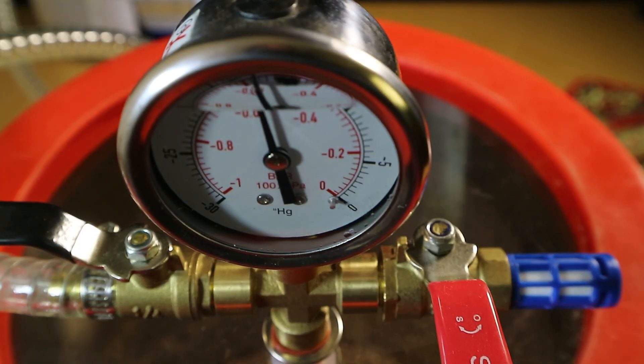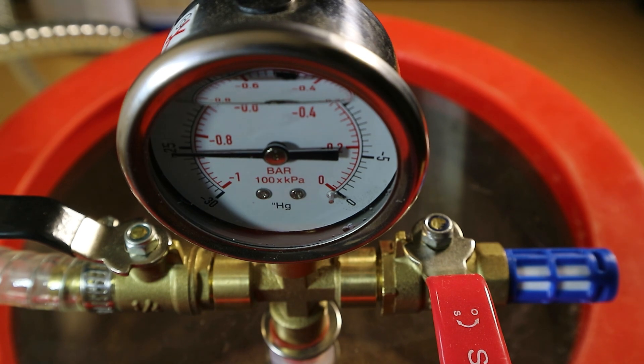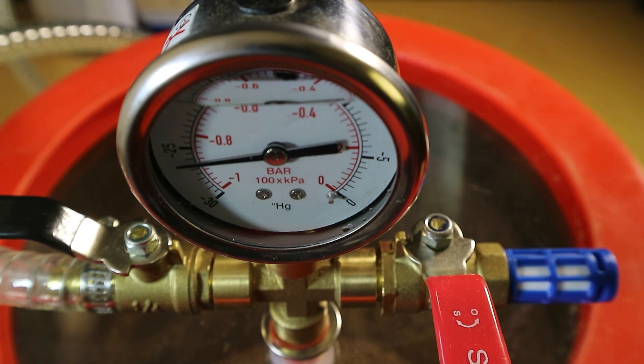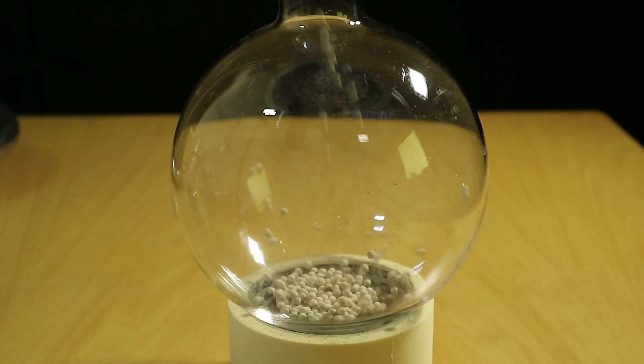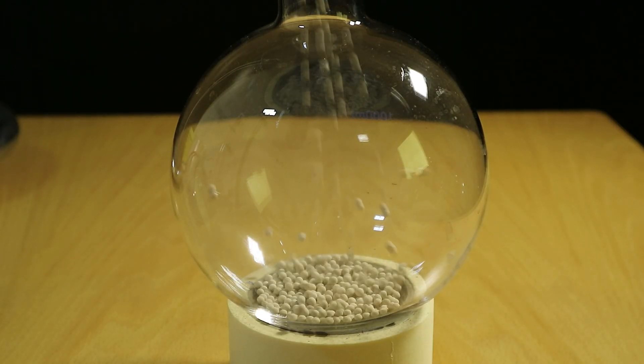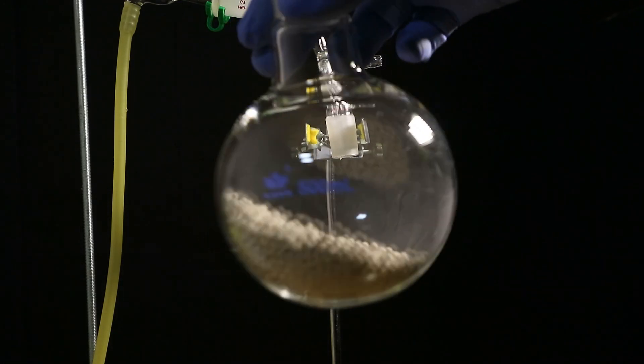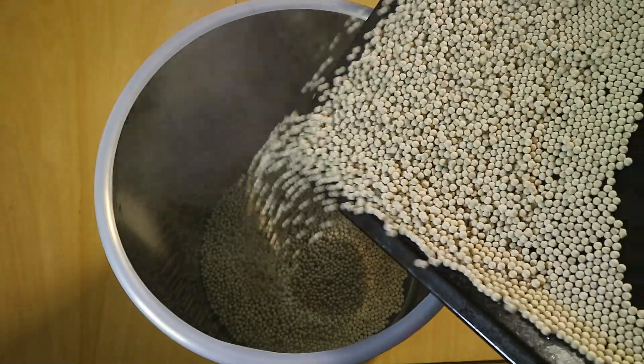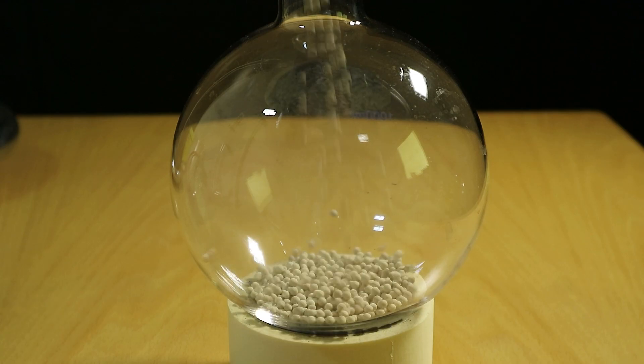I chose molecular sieves because I thought this would be the easiest option out there and it kind of is if you really hate satisfaction. The problem with sieves is as available as they are they're kind of bad at being structurally intact. So there's a lot of dust in them and that dust is very fine and it's very hard to filter out.